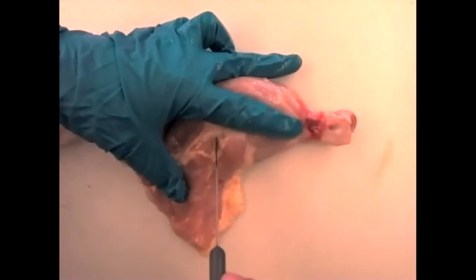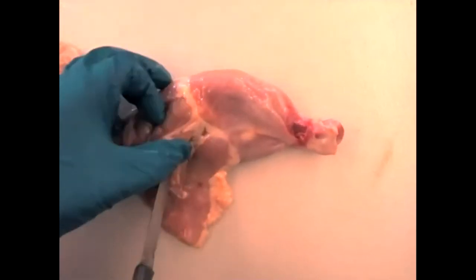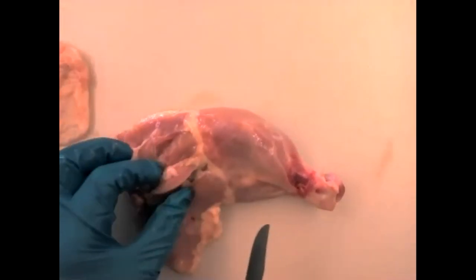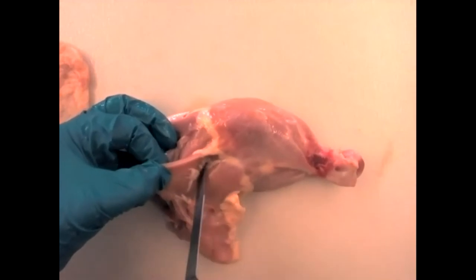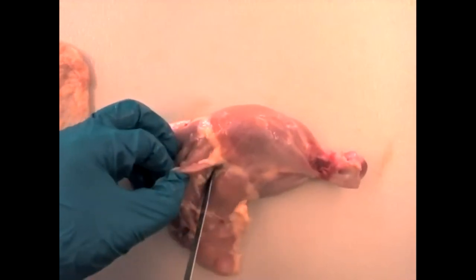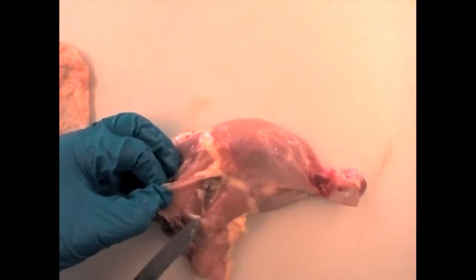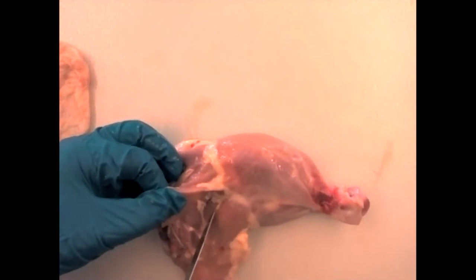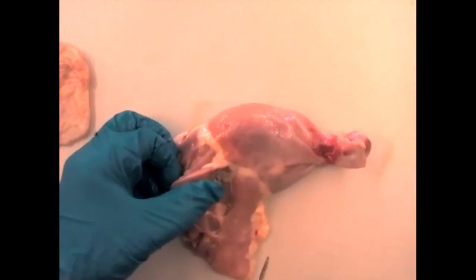I'm using the knife to gently pull these muscles apart. Each muscle is surrounded by an epimysium, making it its own independent unit. To separate multiple muscles, you just very gently run your knife in between them. As we separate these muscles, we can see nerves and tendons. I'm really just showing you the technique — you don't have to separate all the muscles in your documentation, but it does help to see the different muscles.